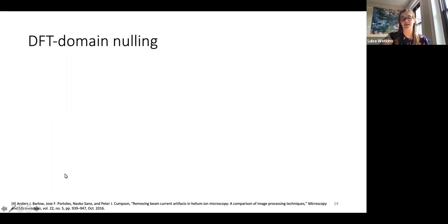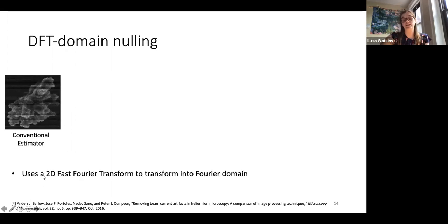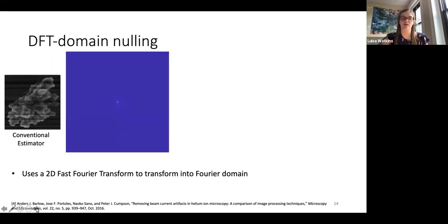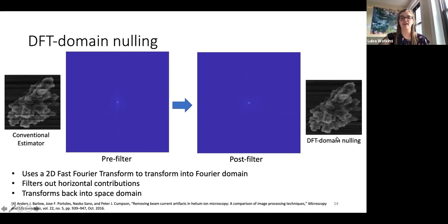That's called DFT domain nulling that takes the conventional estimate and tries to clean up the stripes. So this is an example of a conventional estimated image, and it uses a 2D fast Fourier transform. So it takes this conventional image and transforms it into the Fourier domain. And this is pre-filter. Then it's able to filter out the horizontal contributions. So if you see, there's this vertical stripe here that's faint. It filters that out, and then it transforms it back, and this is the result. So the idea here is it looks at this image and tries to take out the stripes.